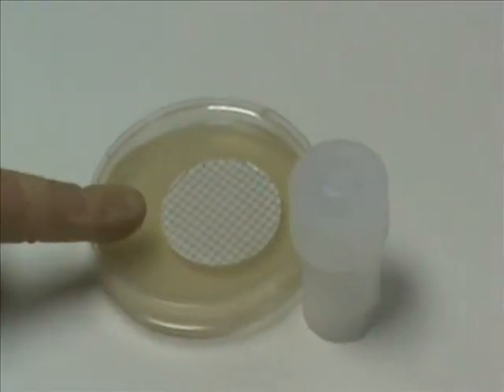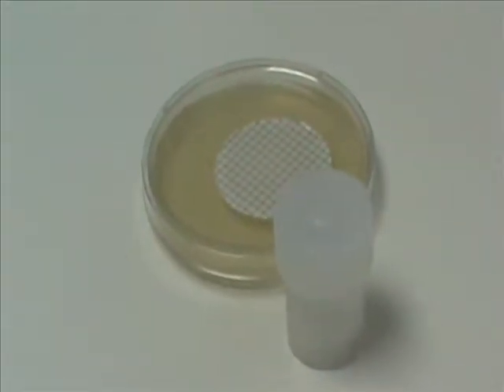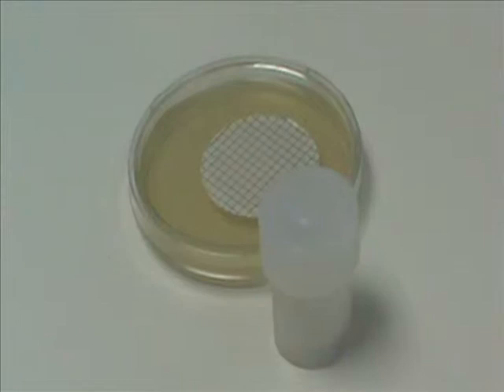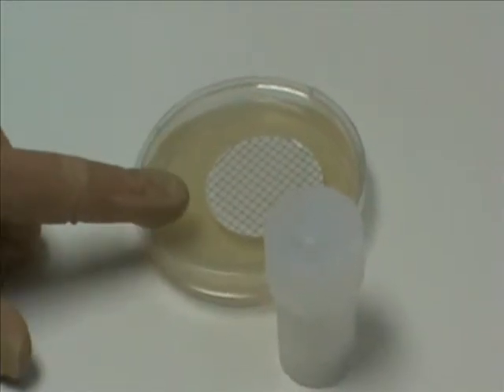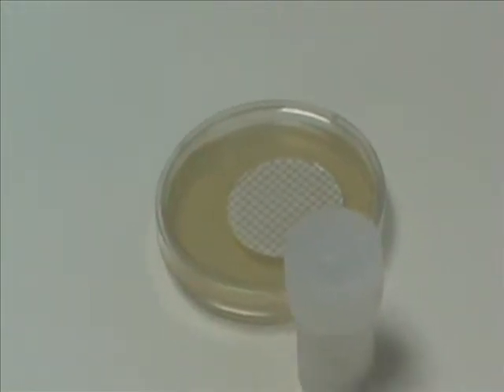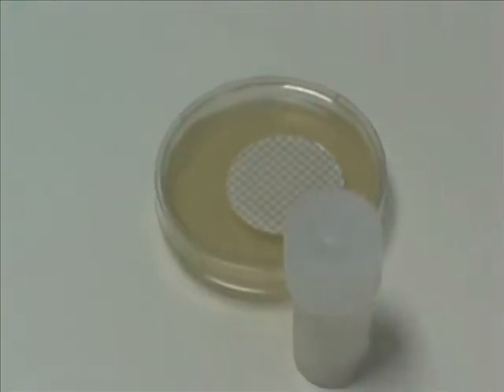The filters are incubated for seven days at the temperature appropriate for clostridium, which is 35 degrees. A preliminary evaluation of the filters is made after approximately 48 hours of incubation because of the organism's tendency to spread across the filter.